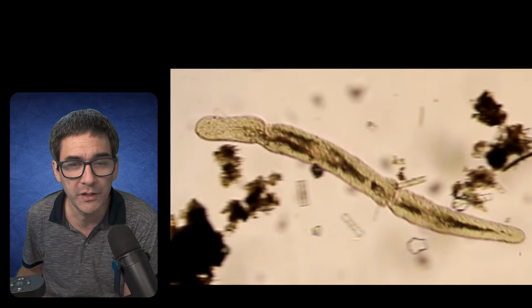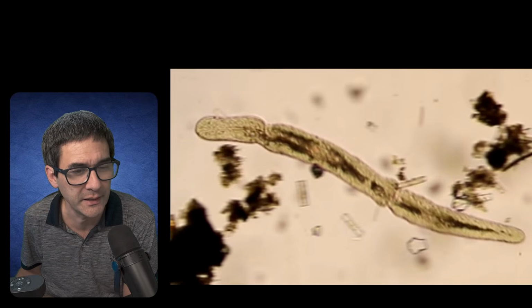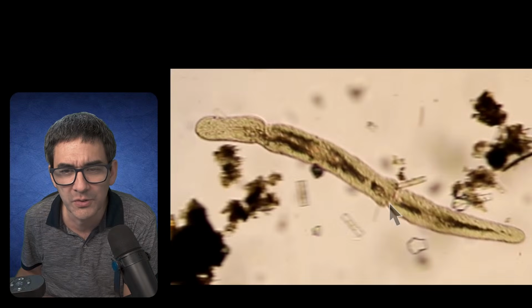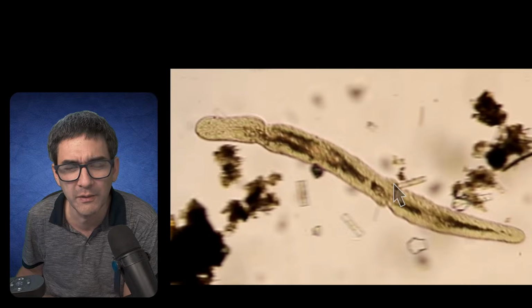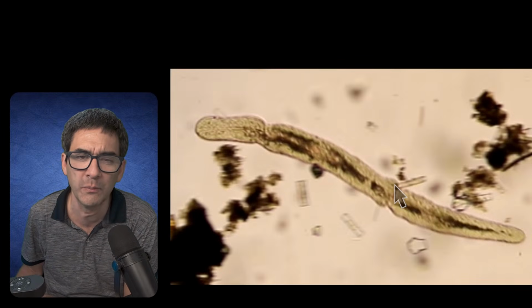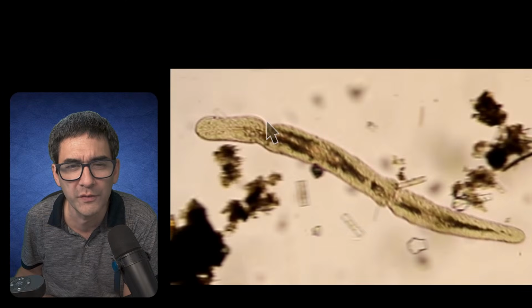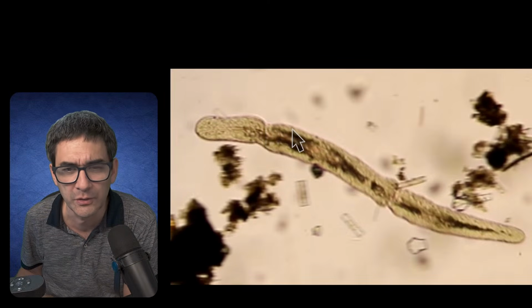And this one over here, I was kind of wondering a little bit when I looked at that. Where's the arrow again? I don't know, but I've seen this also sometimes. If you look over here, it looks almost as if the worm is dividing a little bit. My first instinct is that it's an oligochaete worm, some kind of a worm that has bristles on the side, but I could not see any bristles. But then I saw this part over here and I was wondering if this could be maybe the mouth, if this could be maybe some kind of a flatworm and not a segmented oligochaete worm.